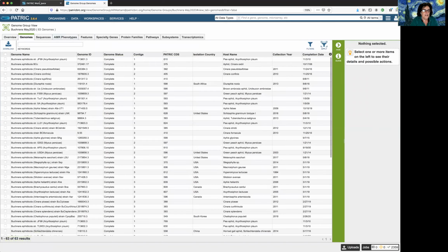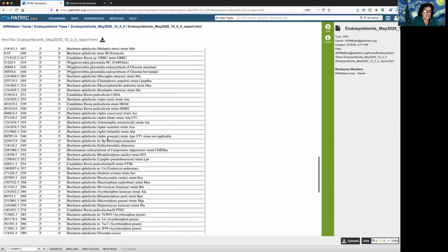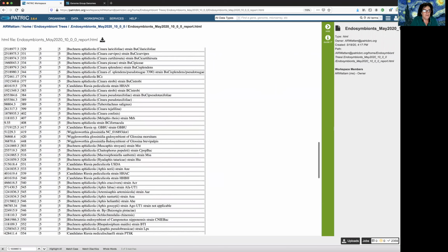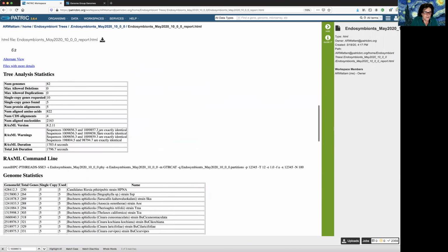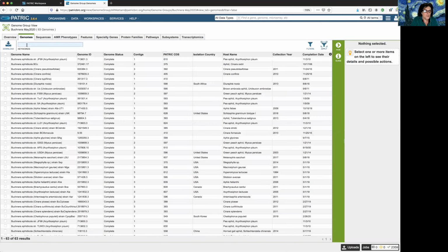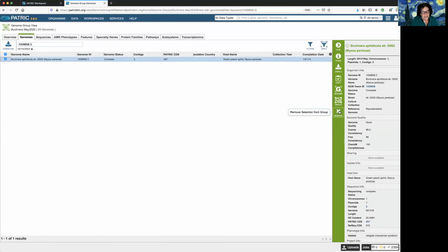And there are the other guys. So I go back to the first tab again. Where was it giving me the warning? Oops, I'm sorry. I know that's annoying to watch people scroll when you're watching it. So it's this guy. Here's another identical one. Once again, in the next tab, I paste that value into the keyword search. It tells me who that is, and I'm removing it from that group.